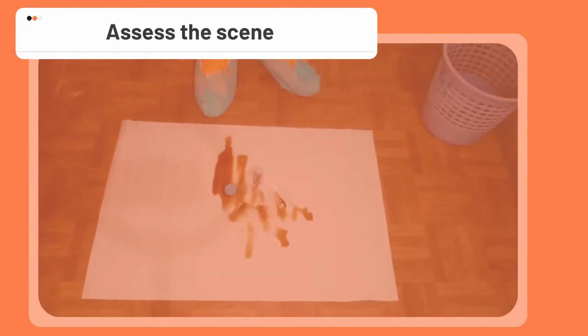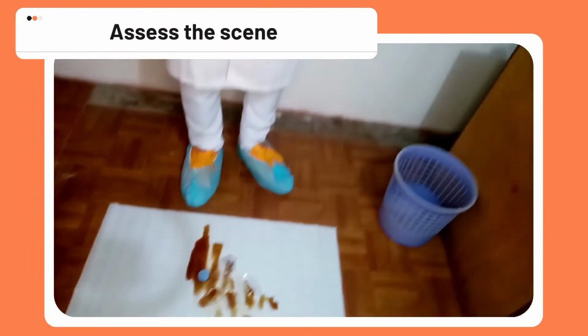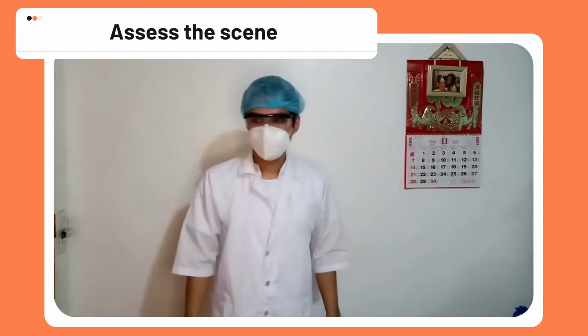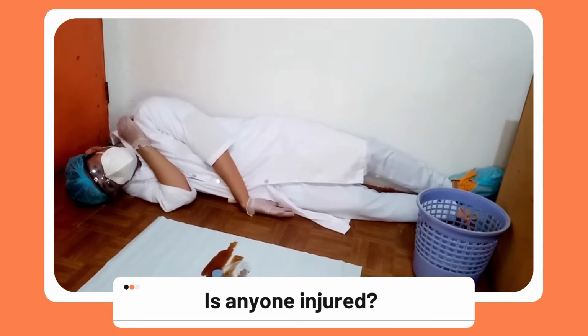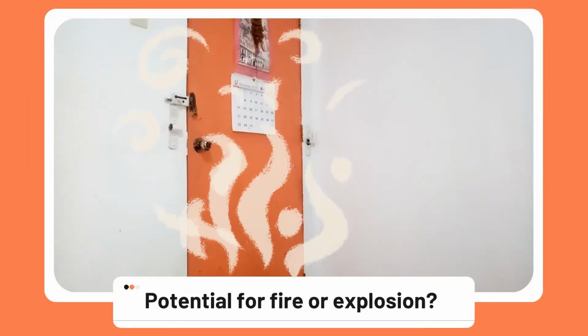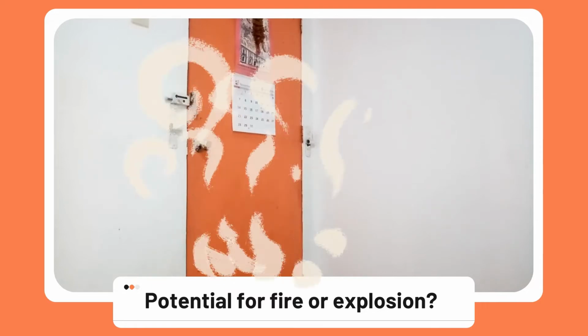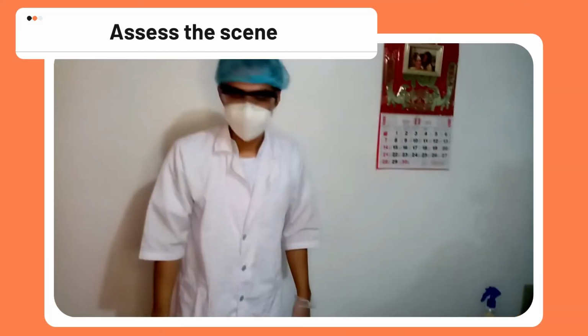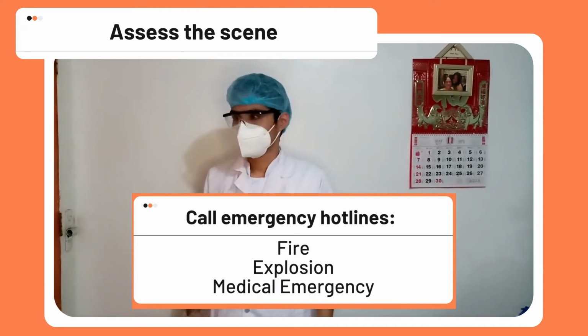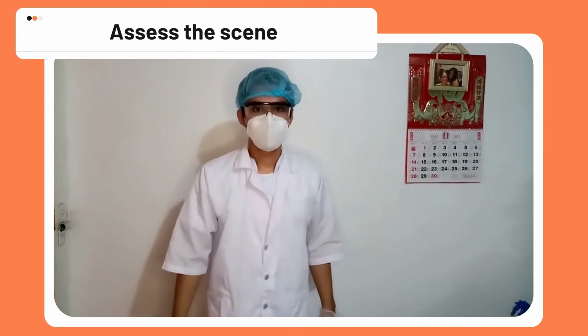The first step of any spill is to assess the scene. Look around and make sure you can answer necessary questions to clean up the spill. Is anyone injured? Is there potential for fire or explosion? If there are injuries or you see any potential for the spill to escalate, call emergency hotlines.